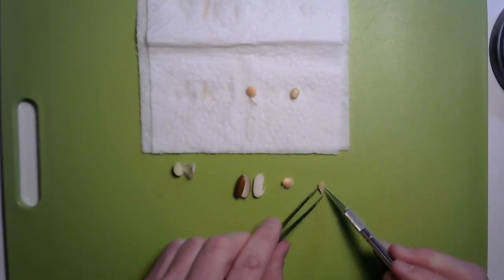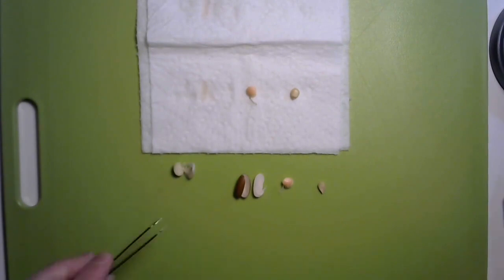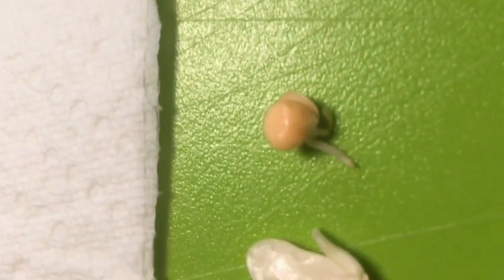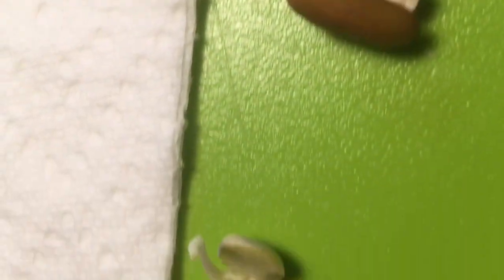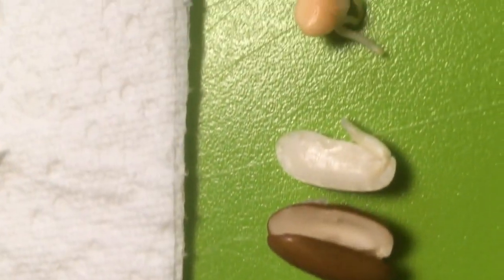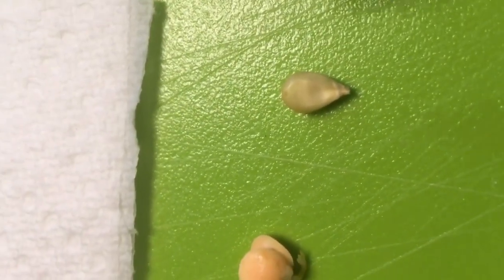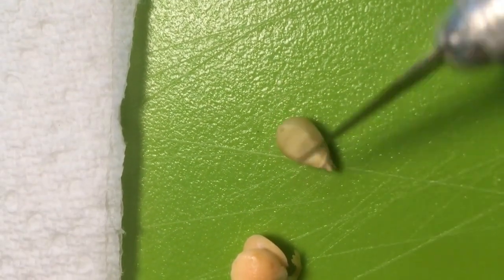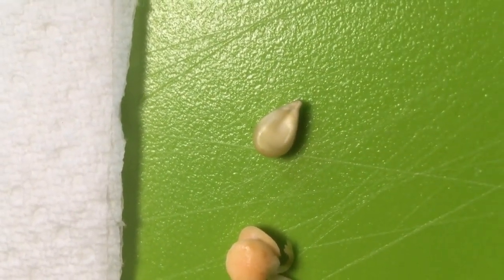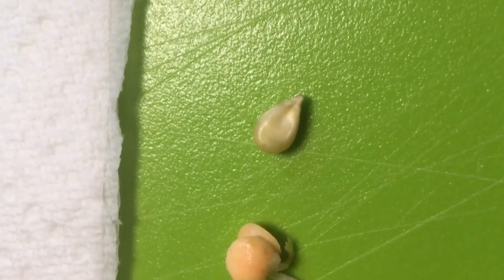Okay, now on this one I'm noticing there doesn't seem to be sort of a divide. I'll show you really close up too. Notice with these ones, there seemed to be like a ridge or something that divided them into half, but with this one it just does not seem to be anywhere to cut it easily like that. Well, we'll just have to cut it right down the middle.